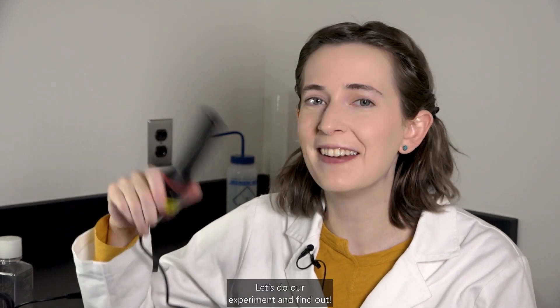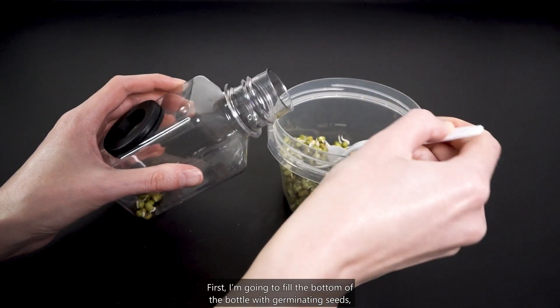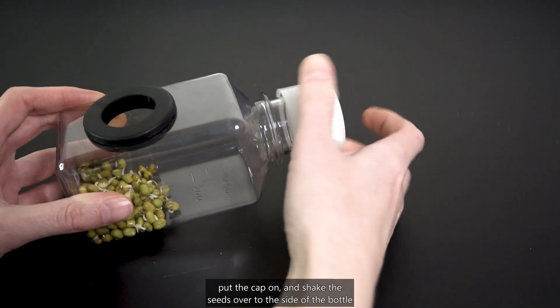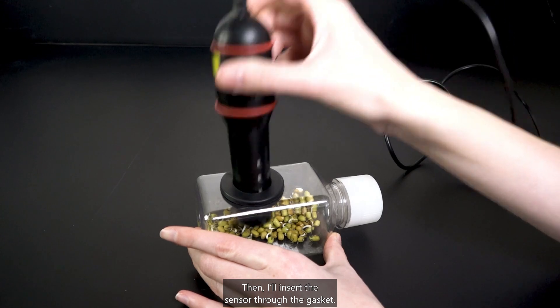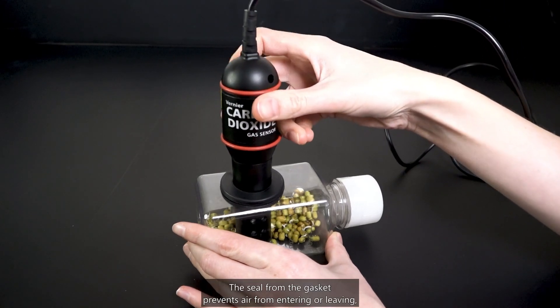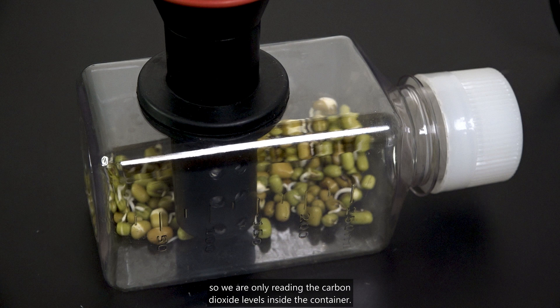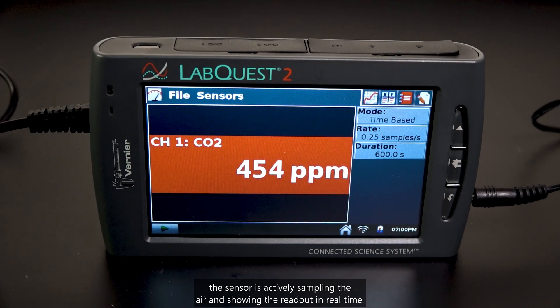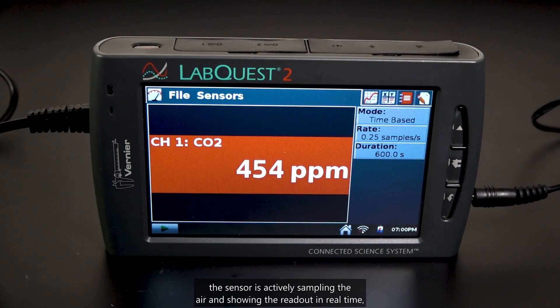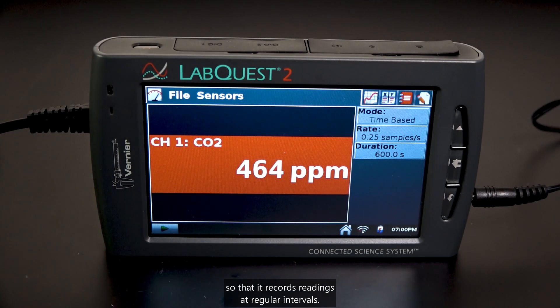Let's do our experiment and find out. First, I'm going to fill the bottom of the bottle with germinating seeds, put the cap on, and shake the seeds over to the side of the bottle so they're out of the way. Then I'll insert the sensor through the gasket. The seal from the gasket prevents air from entering or leaving, so we're only reading the carbon dioxide levels inside the container. In the current display mode, the sensor is actively sampling the air and showing the readout in real time.